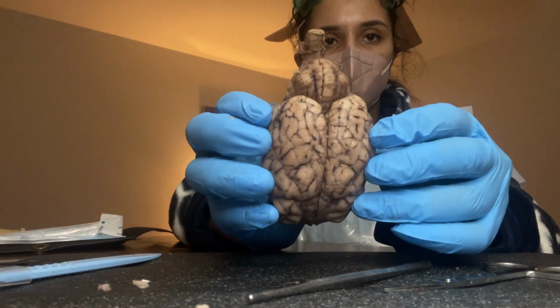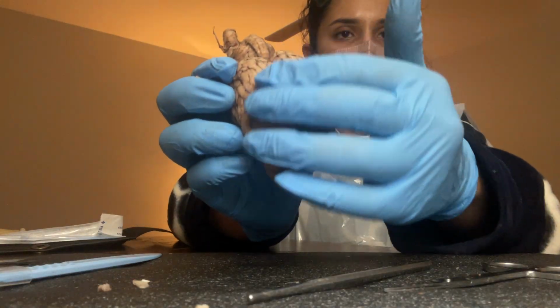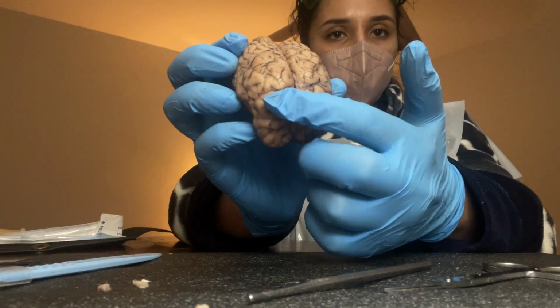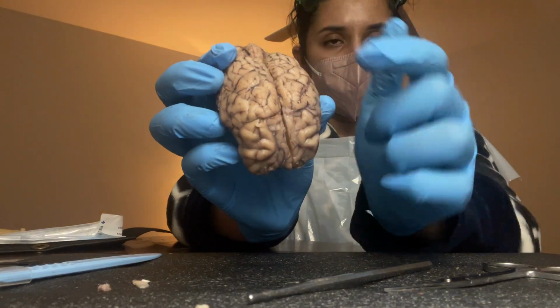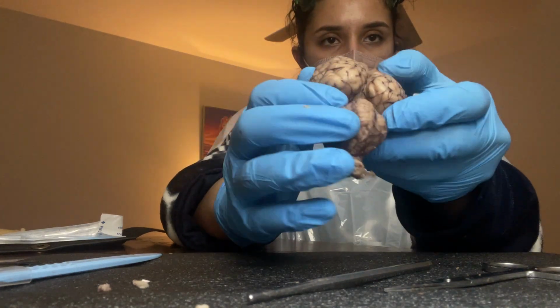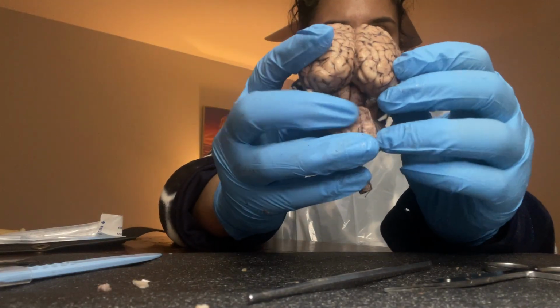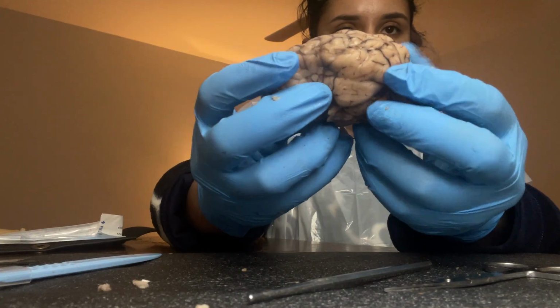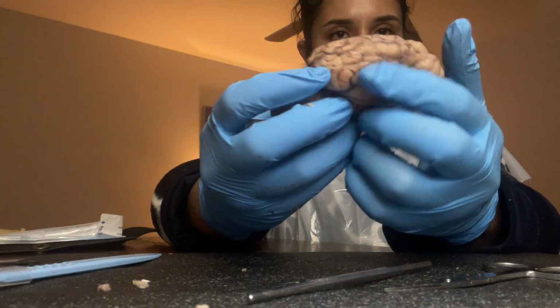So we're going to start with the cerebrum, and basically the cerebrum is this whole thing where we talk about the frontal lobe. We have left and right hemispheres. We have the left and right frontal lobe, and then on the other side we have the parietal lobe. So we have a left and a right parietal lobe, and then we have the occipital lobe. We have left and right hemispheres, so it's basically these two. And when it comes to the temporal lobe, the temporal lobe is going to be right here on this side of the hemisphere, and then on the other side as well.